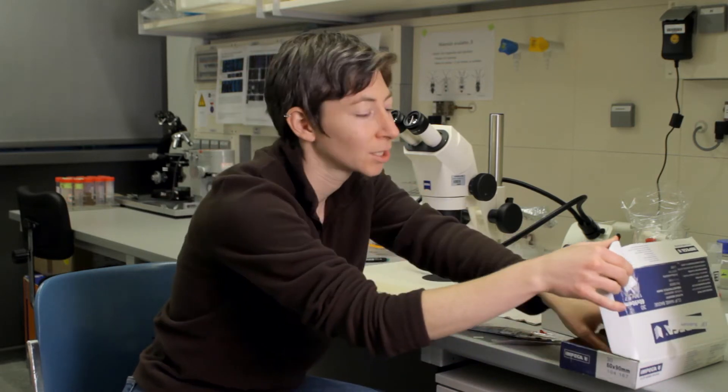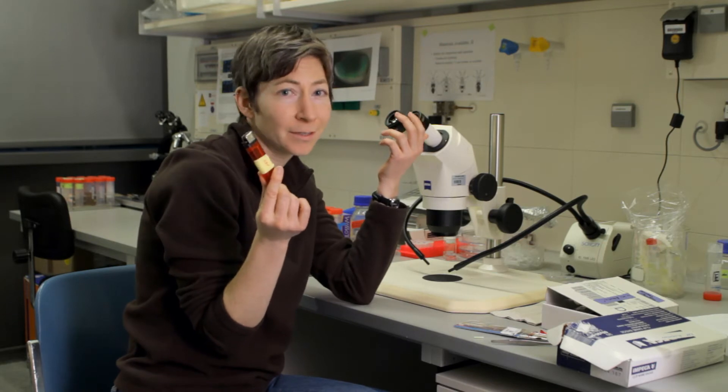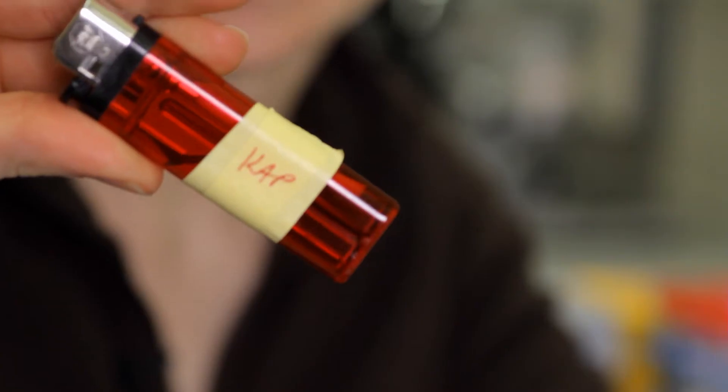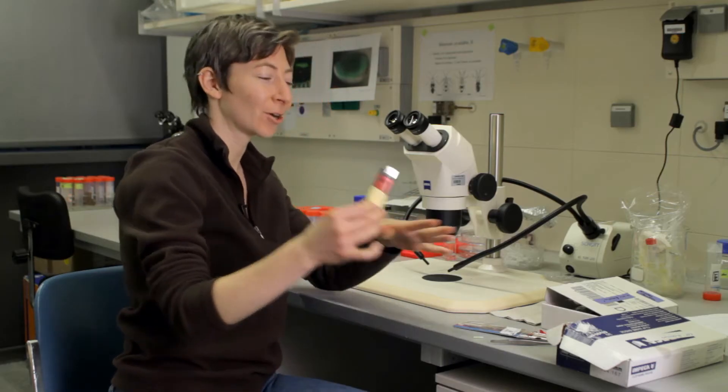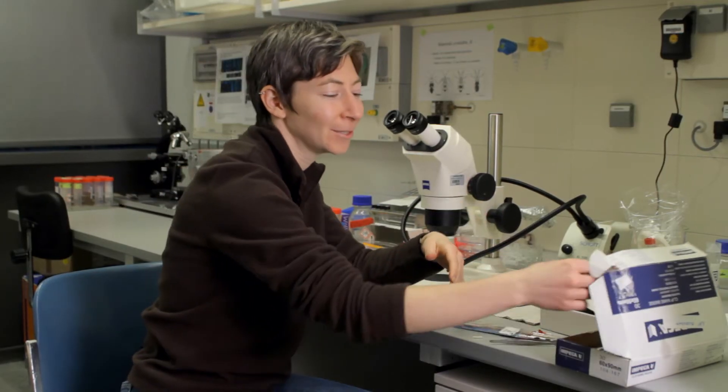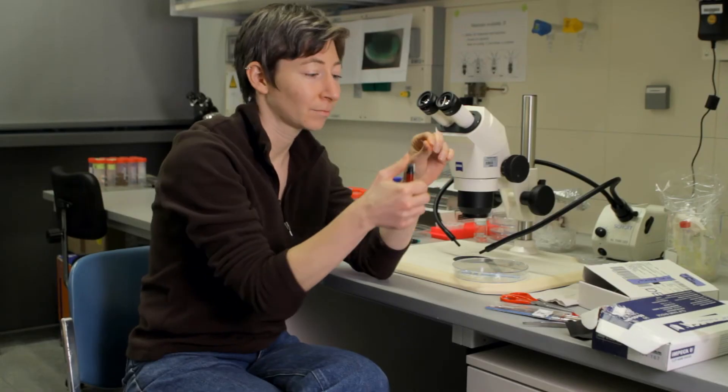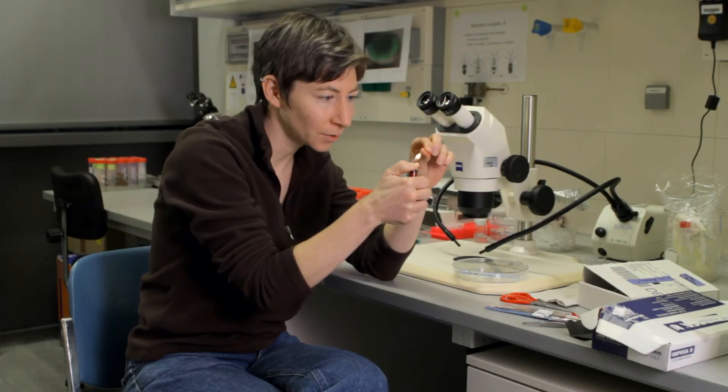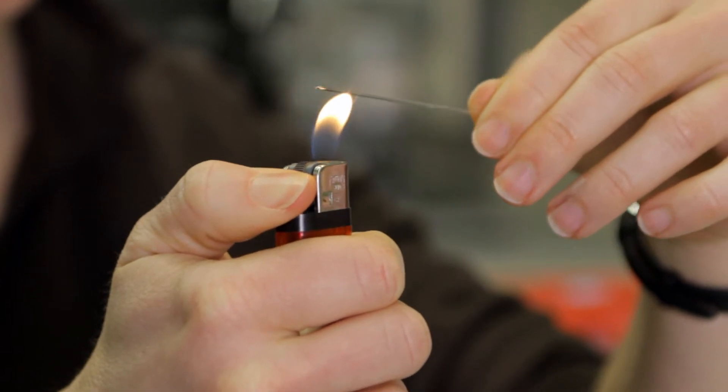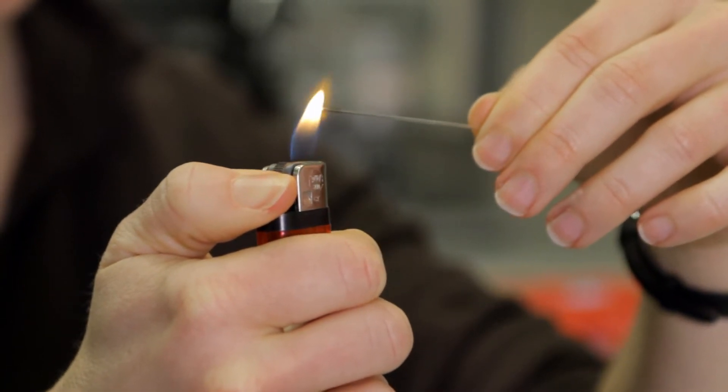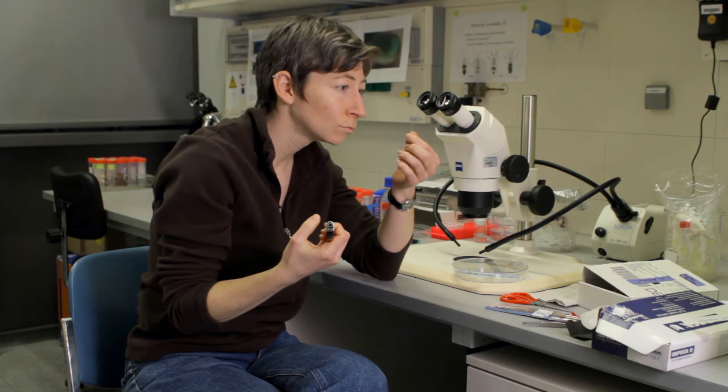In order to make that sort of tool, because it's just glass and they break, I have amongst other things a cigarette lighter. I don't smoke at all, so I put my initials on it because it's part of my official microscopy toolbox. You kind of do it by eye and you simply flame the end until you've melted the glass back a bit. Looks pretty good. Now I have a new tool already.